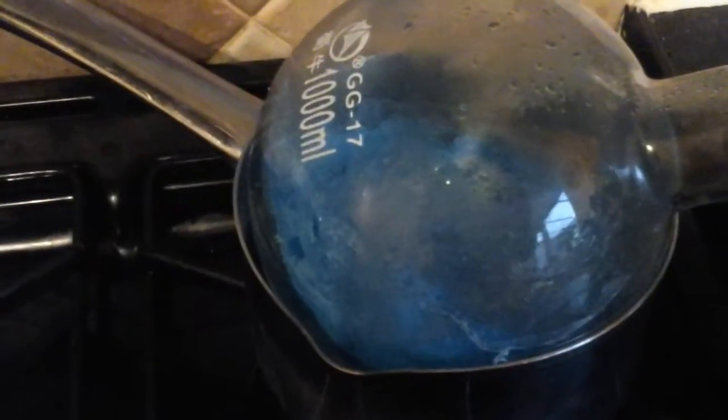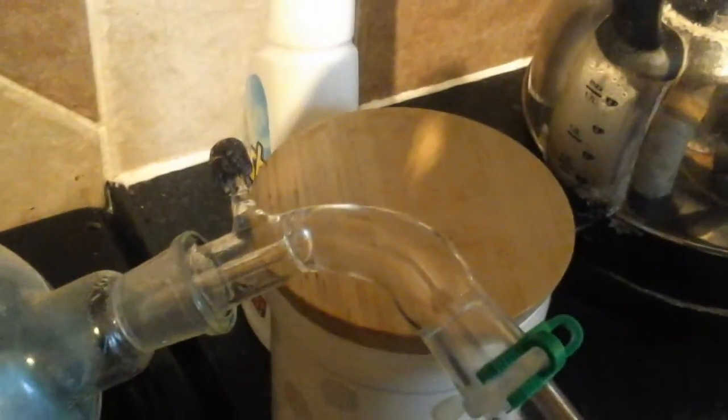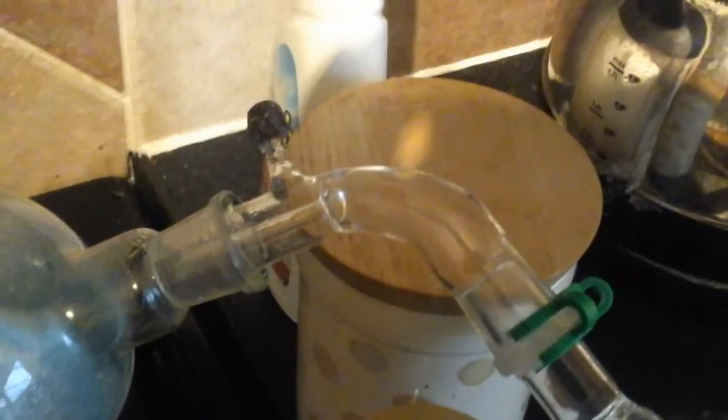On top is the blue orb, a piece of laboratory glassware which has no hope of ever being clean again, with the last of the dichloro bubbling away in the bottom. It's mostly used up now. This goes into the wrong labware because I haven't got the right labware, with a little bit of modelling clay to block the nozzle there.